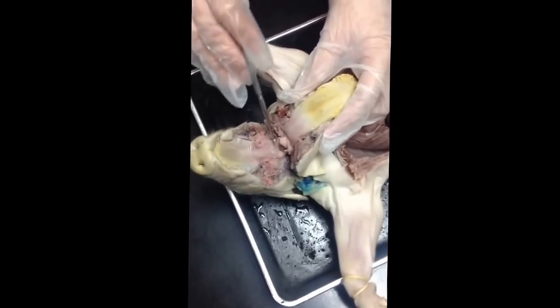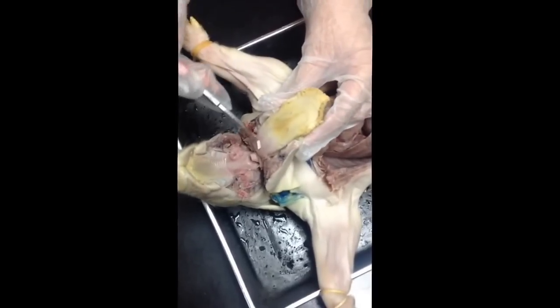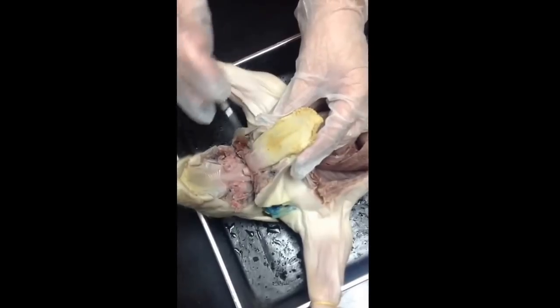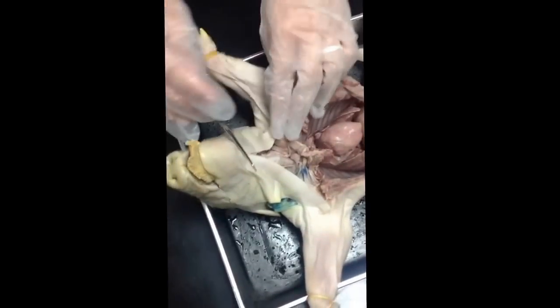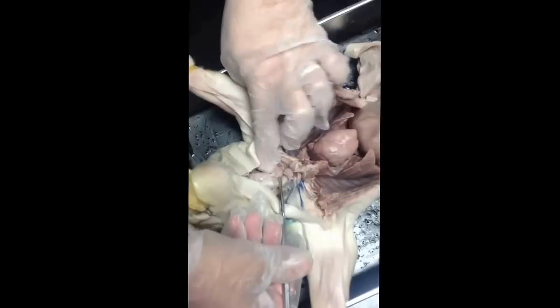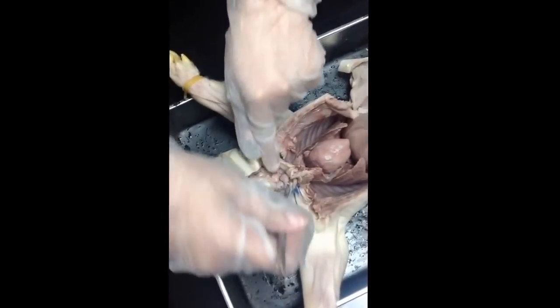soft palate. This flap is the epiglottis. It keeps you from choking. This is the tongue and the sensory papillae. You're pretty much certain that I'm not going to ask for that tongue. It's too obvious. But the moment you see me scoop out a soft tube from behind the trachea, that tells you this is the esophagus.